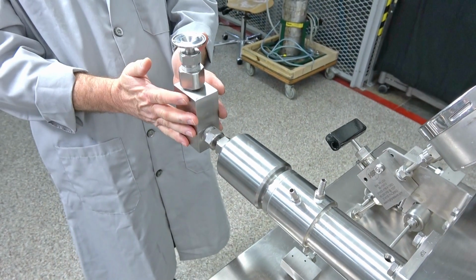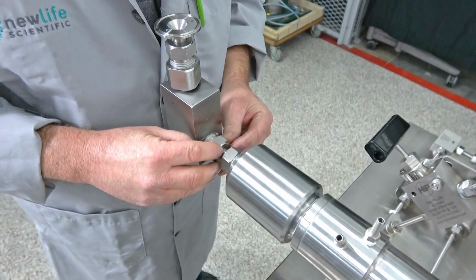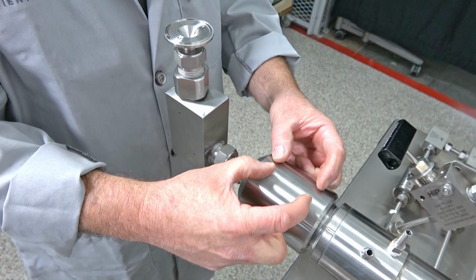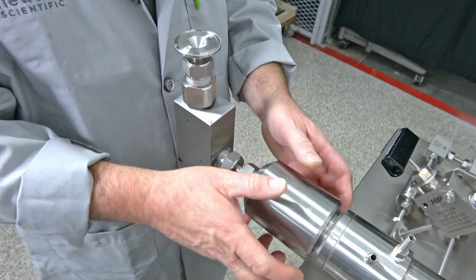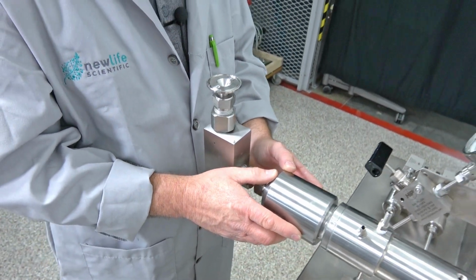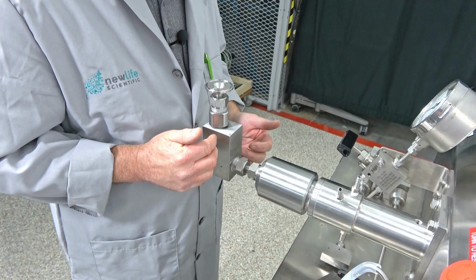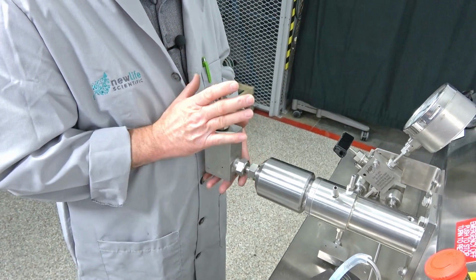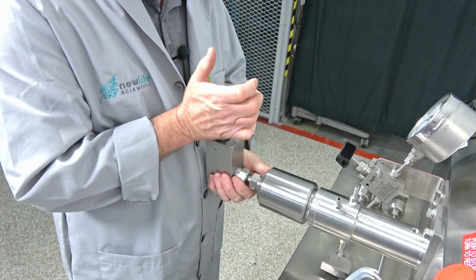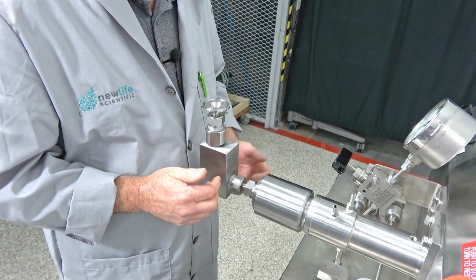Sometimes you might not get this quite straight, but these have a little bit of wiggle room. Some of them don't. Some of the older models actually sit up here, and you would have to get this perfectly straight to have your reservoir sitting perfectly straight. This one is a little bit different. The newer models come out the front instead of coming off the top. So these aren't near as bad, because you can actually adjust this without adjusting this. So getting that tight right there, and then you can bump this back a little bit because of the flex it has in here. So yeah, that's about it.